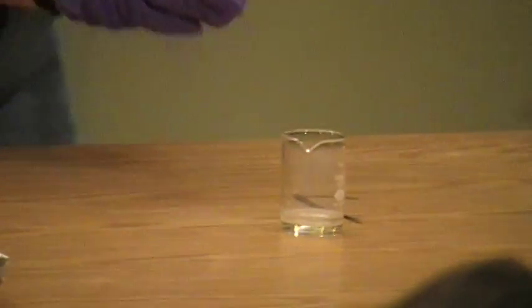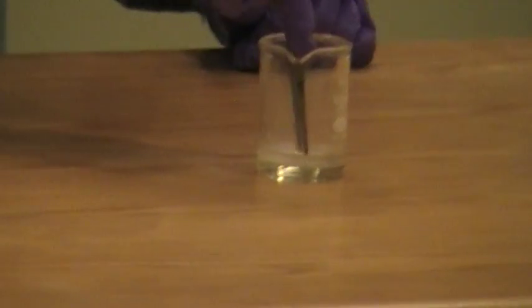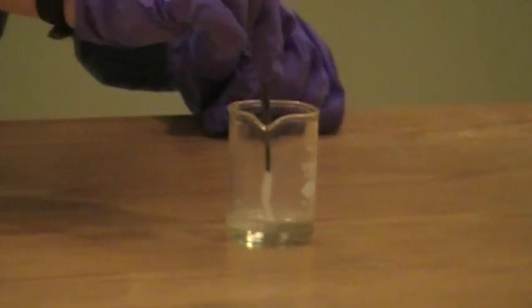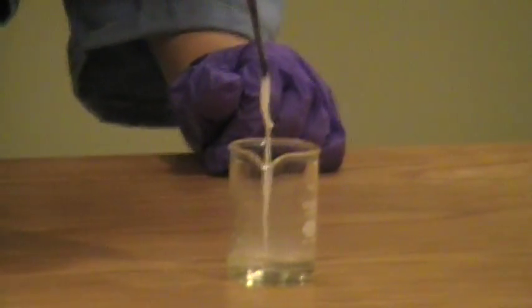And just at the, I don't know if you can see the little bit of HCl coming off of that. But just at the interface is where the nylon is being formed. So what I'm going to do is grab down here and, if I was a really good machine, I could make a nice, even thread.